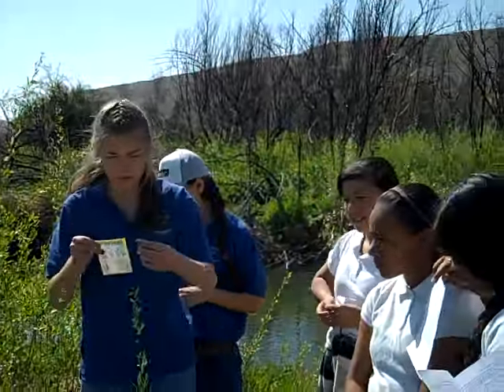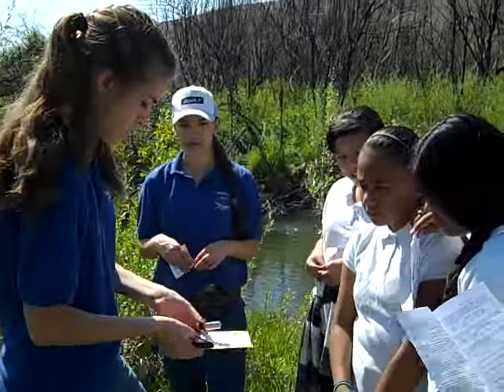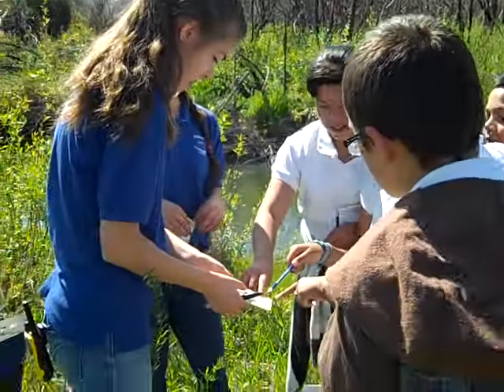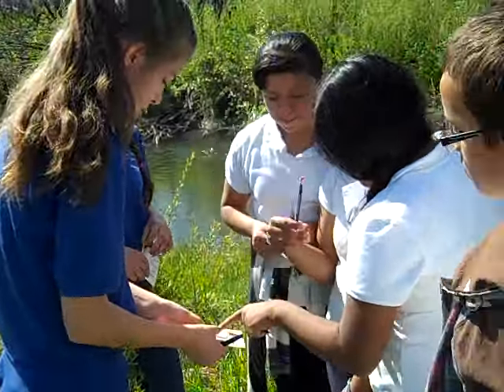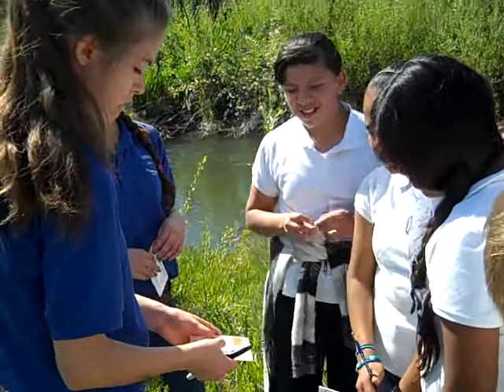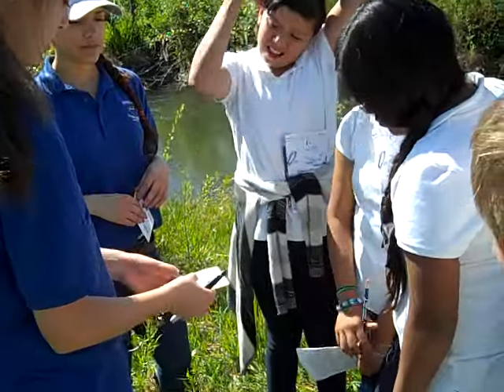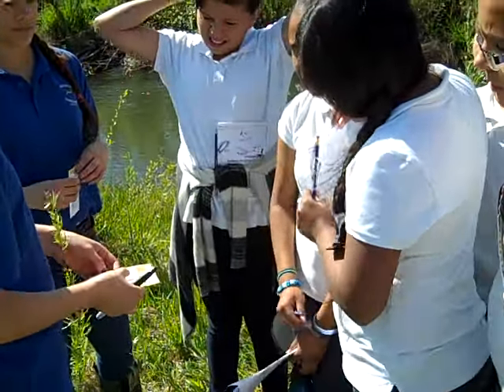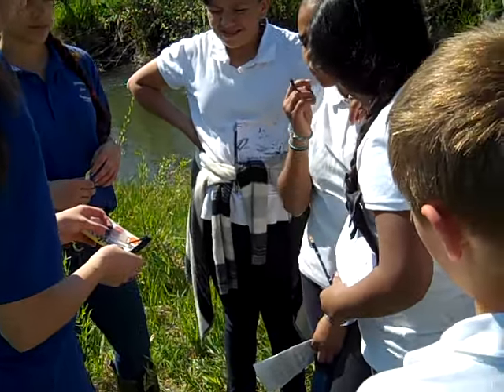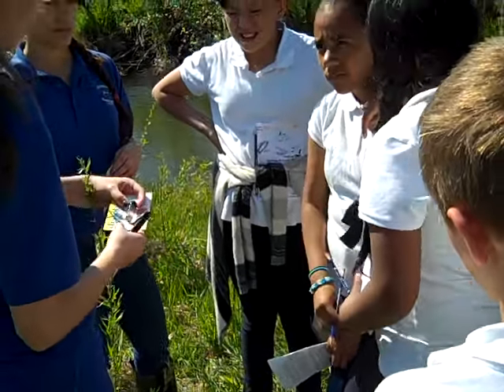Alright, so this is how much dissolved oxygen there is. What would you guys say that is? Four. Between those? Yeah, so that's ppm, parts per million. That's the way we measure dissolved oxygen. It's really, really small, but it makes a big difference, depending on 0 and 8. This is about what we want for the creek. It's right between there, so that the fish and animals can breathe.